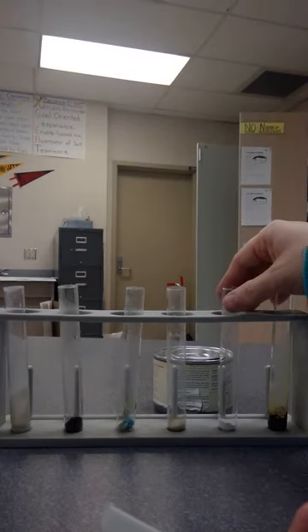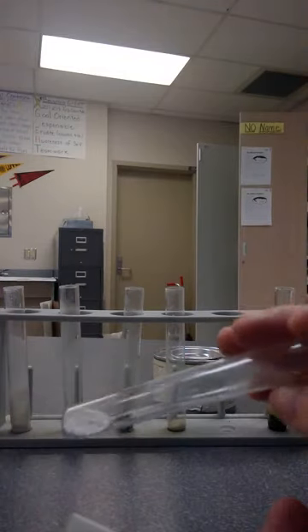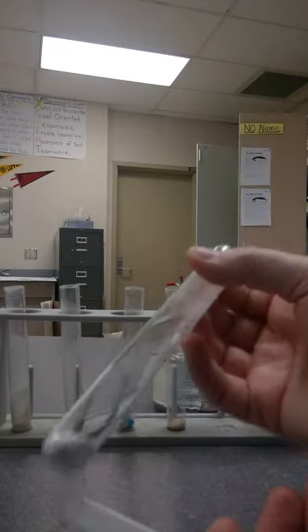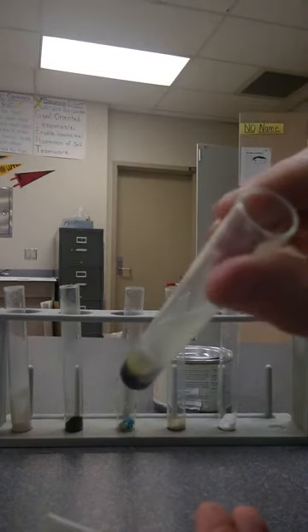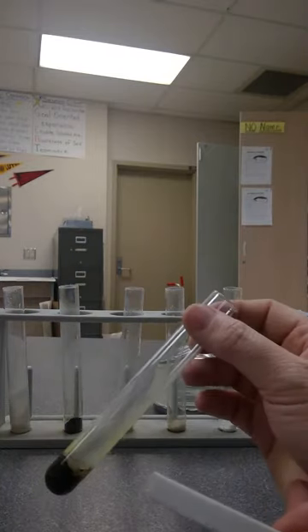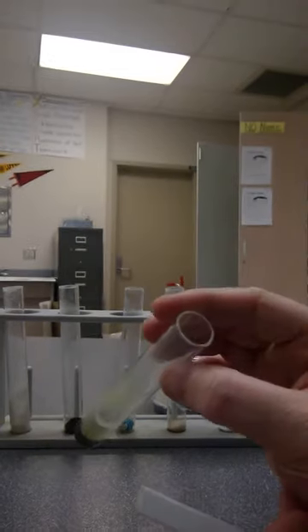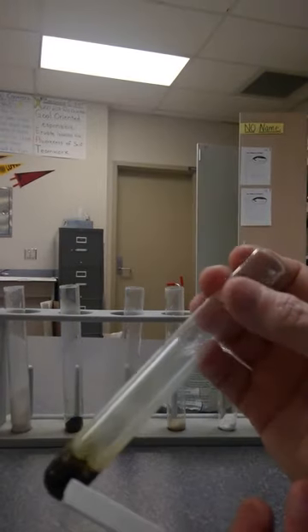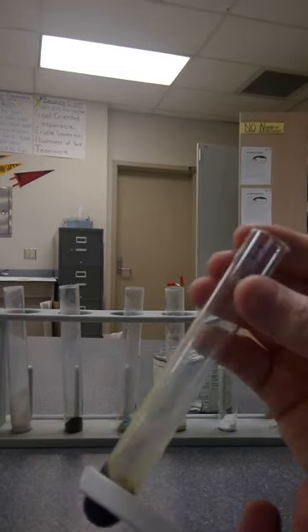Our next substance is zinc oxide. It was getting a creamy colored yellow when heated, and as it has cooled it's actually returned to its white powdery state — so it changed while heated and then went back afterwards. Lastly, the sulfur is still cooling a little bit on the inside, with a tiny bit that is still liquid. There is quite a putrid smell from this one — a sulfur smell, kind of that rotten egg odor. As it's cooling, it's starting to harden and sticking to the sides of the test tube.